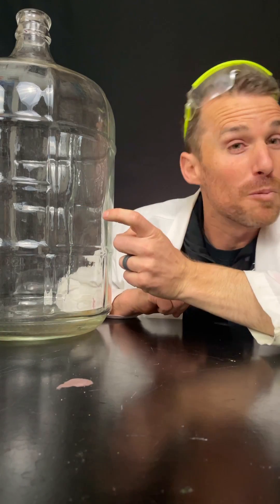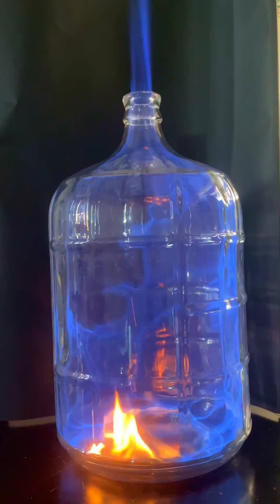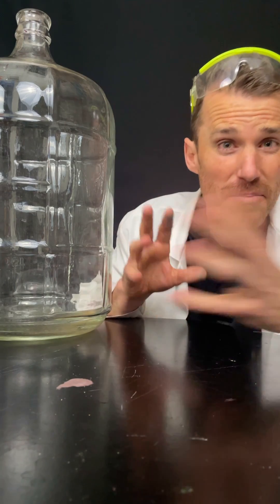Number two, don't do this one at home. This is the whoosh bottle. It gets really hot. You could burn yourself, and it's really high pressure, which means things can explode.